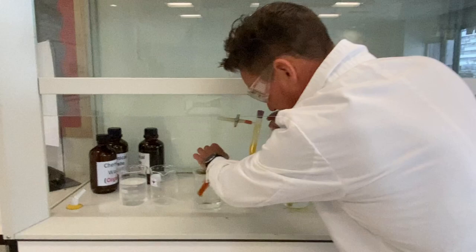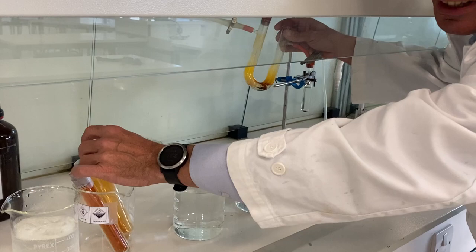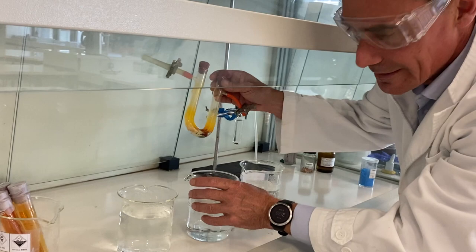What happens if I put it in hot water? What happens if I add heat, let's see what happens. This is the old experiment, we'll probably just get rid of that, this was the old equilibrium we were looking at last time. We're just lazy though, we can't be bothered to put more beakers out hot and cold, sorry about that.